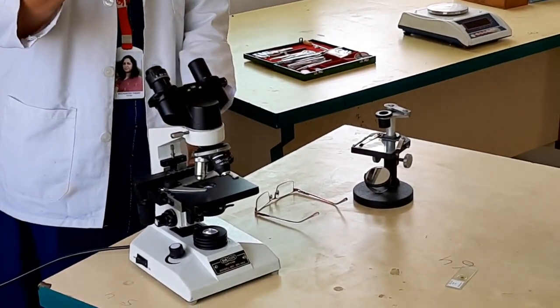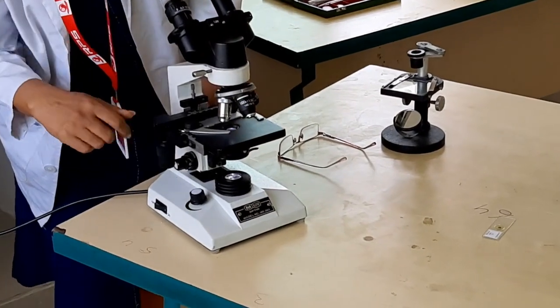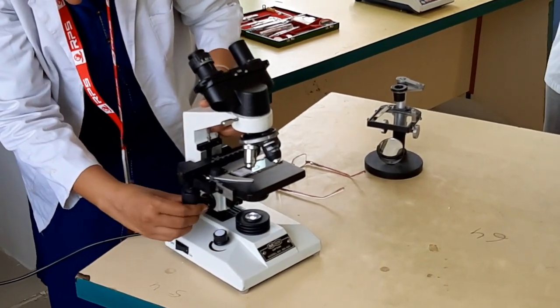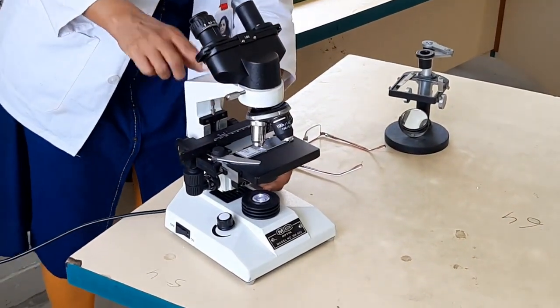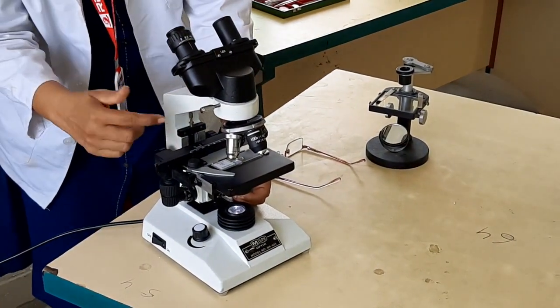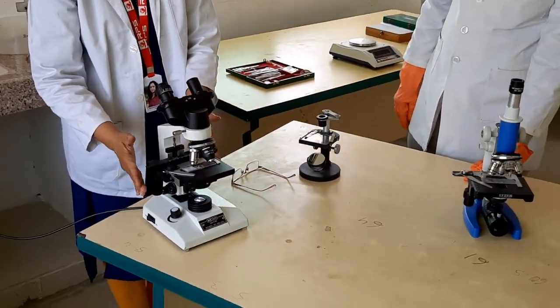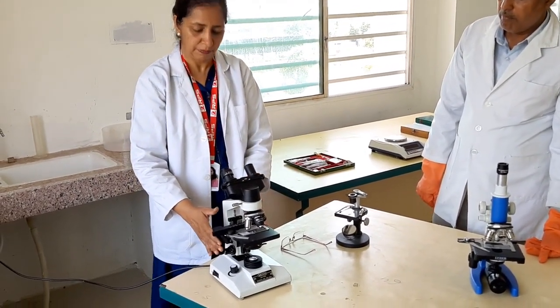With the binocular microscope, you get a 3D view of the object, similar to how our eyes naturally see. The illumination is also very bright here, powered by an LED bulb running on electricity, so the illumination power is high and visibility is very clear.